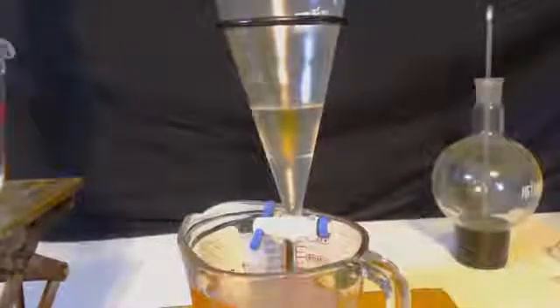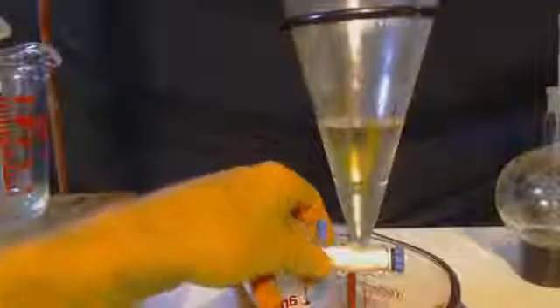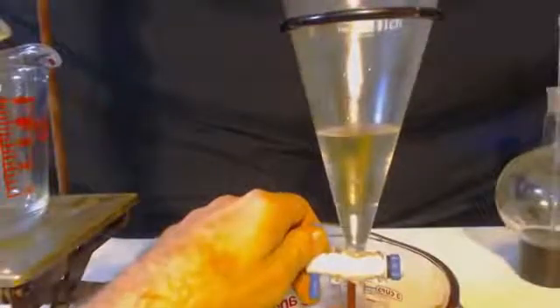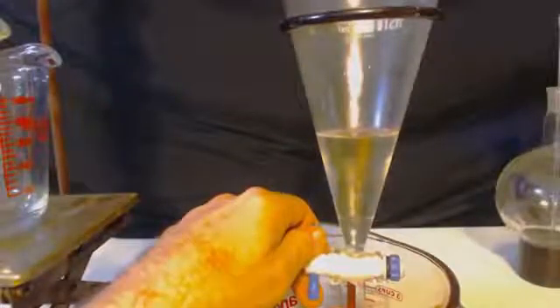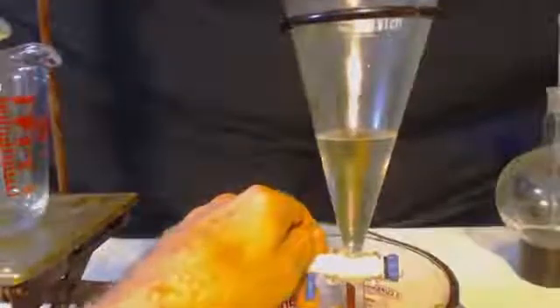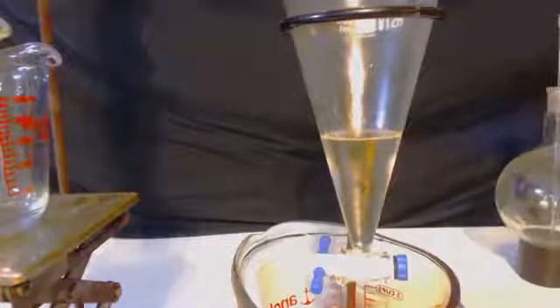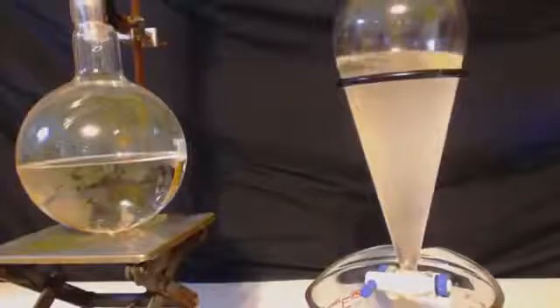So, I'm going to shake it up, let it sit for a while, and drain it out, and then I will have half of the can, just the hydrocarbons of it. I will set that aside, because I still got to do the other half of the can. And I'm basically going to do the same thing. I'm going to wash it twice with water, and then put the two halves together, the two hydrocarbons halves together.